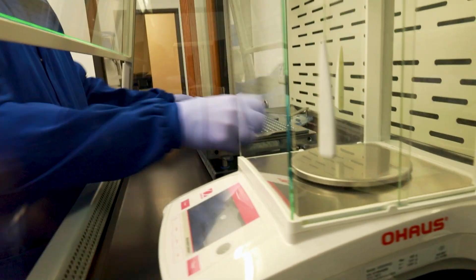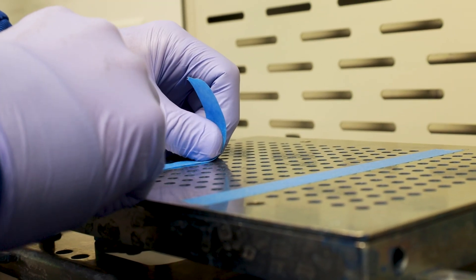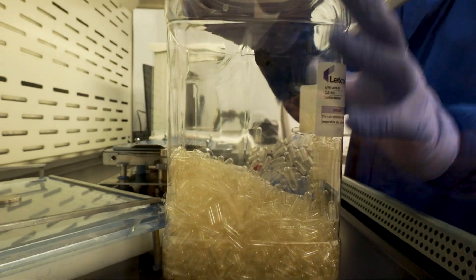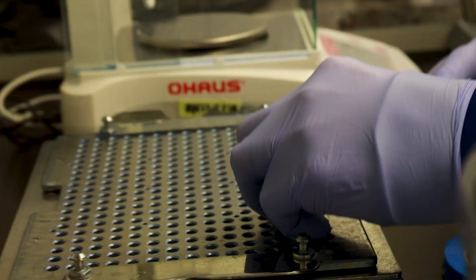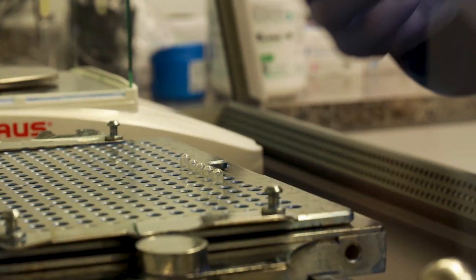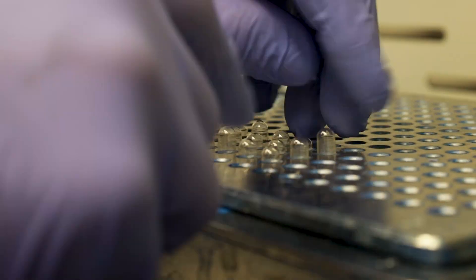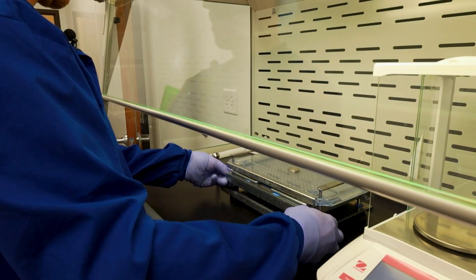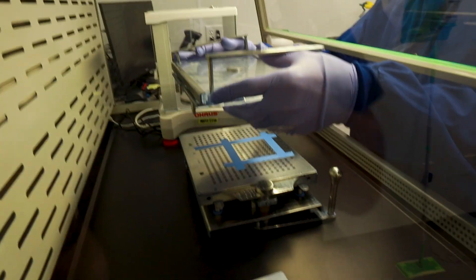So I'm going to set that off to the side for right now. Let's load some capsules in here. I don't think I want to do 300 though. We're going to make just a few capsules today. We're not going to make a ton. Let's just tape that off. I'm going to load that up with some capsules. Size three. Let's see if I can do this right. Aha, got that part done.